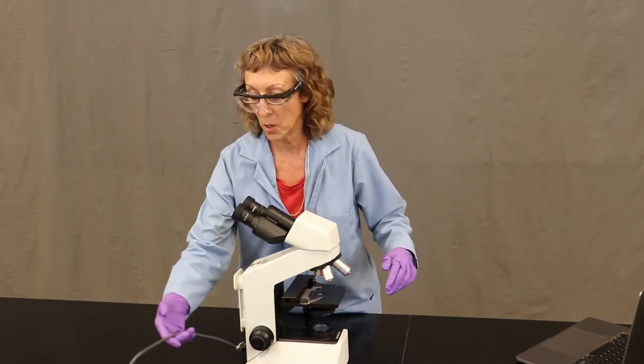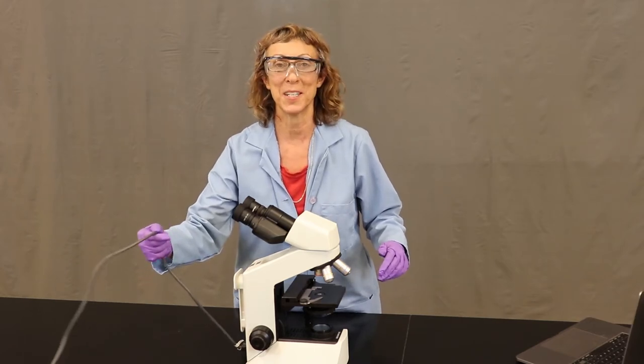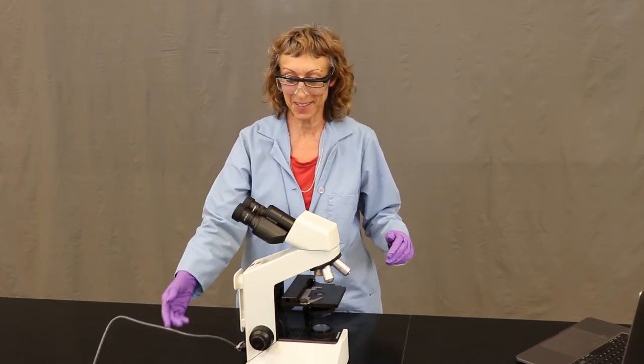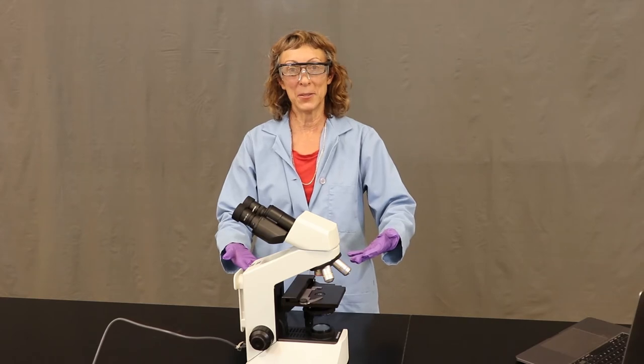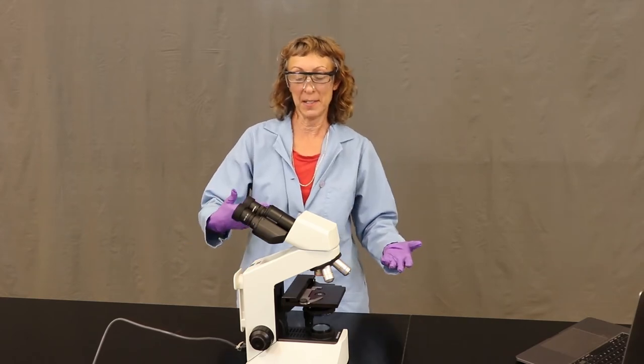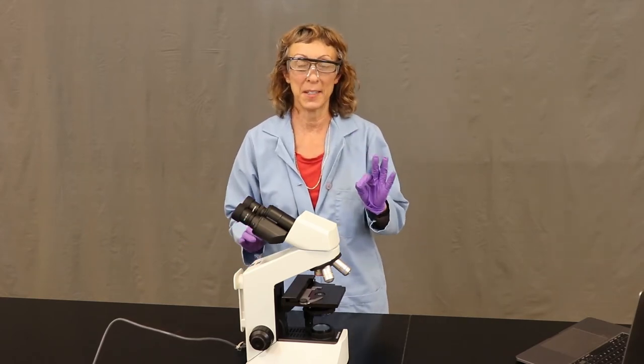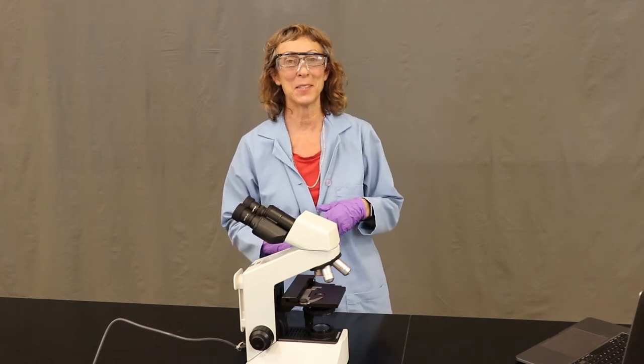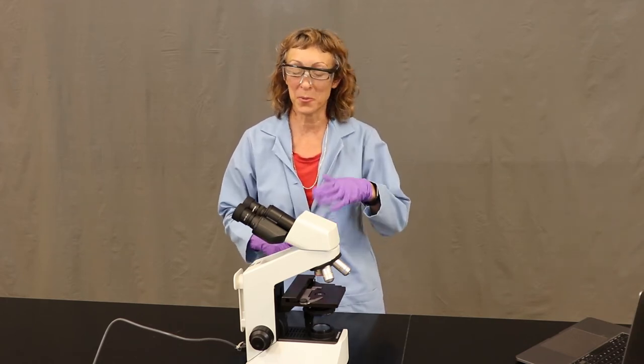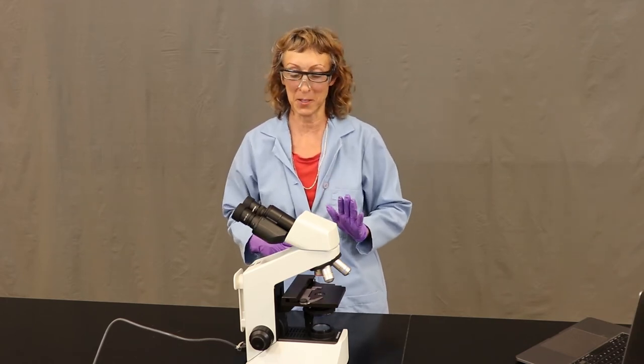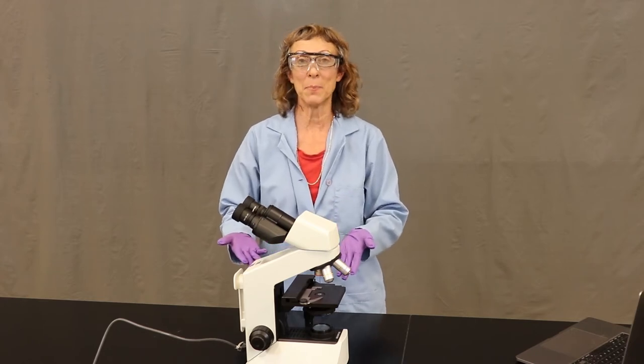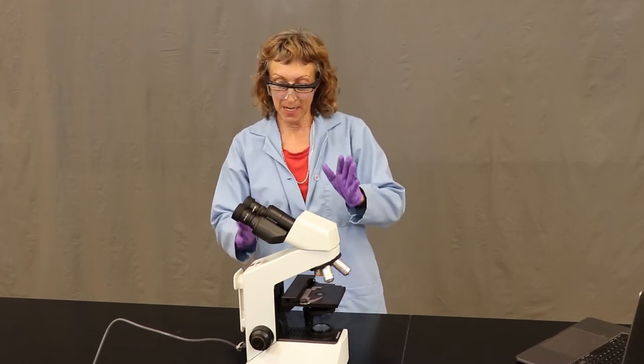Okay, so first of all, all of these microscopes need to be plugged in. This one already is, but before it got here to this counter, I carried it here. And one important thing that when you get back to school and you're back in the classroom where you get a job and maybe you have to use a microscope, they're really quite expensive and delicate instruments.